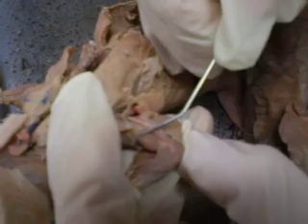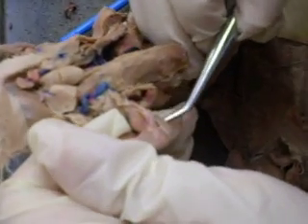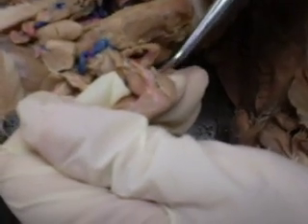Followed by triceps medial head, it's not cleared out very well. But if we ever separate it into 2, like this part here, that's your triceps medial head. Triceps long head, right here. The long head would be like the bottom part.